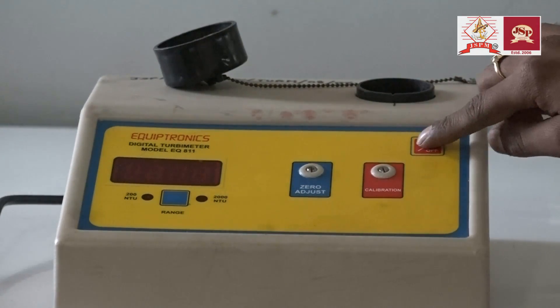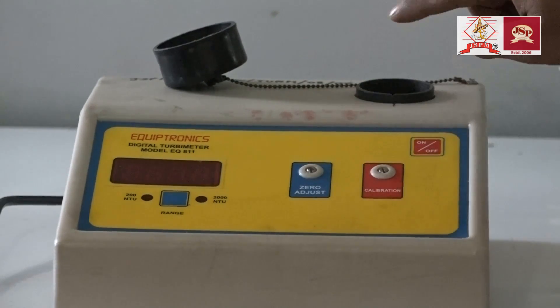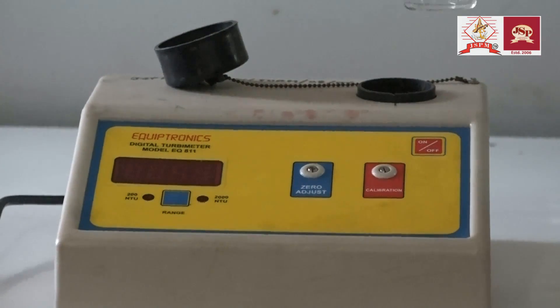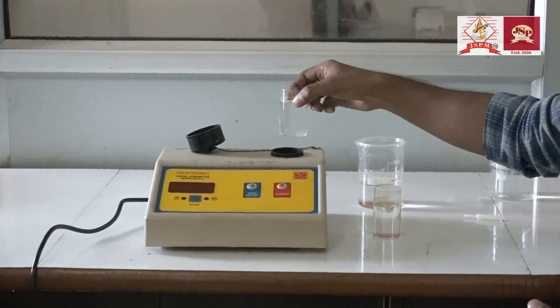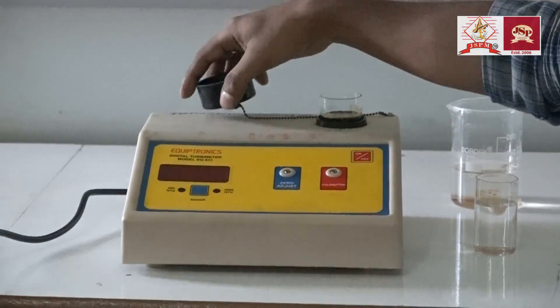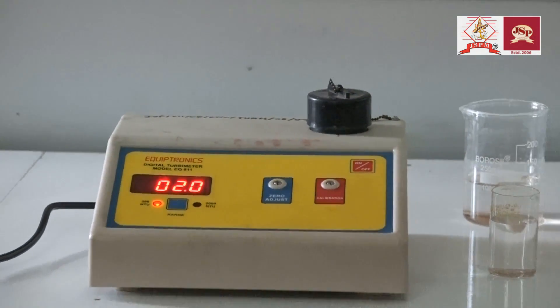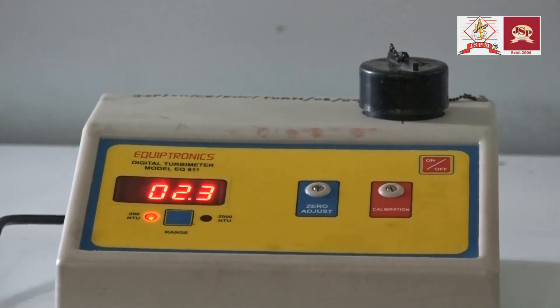We are going to start the experiment. Before that, we have to adjust the zero of this instrument. It is adjusted by taking distilled water in this glass tube and putting it into the space. Now I will close this lid and switch on the instrument. Now it shows some numbers but it is not zero.